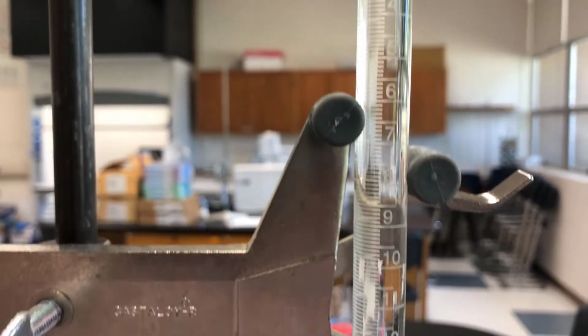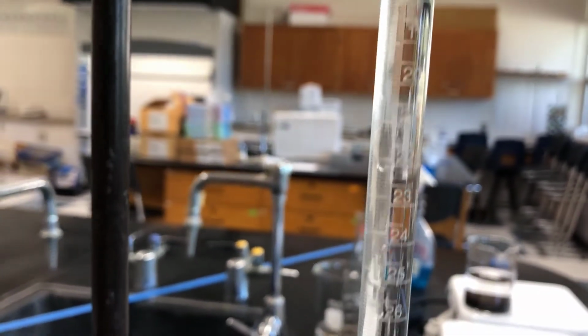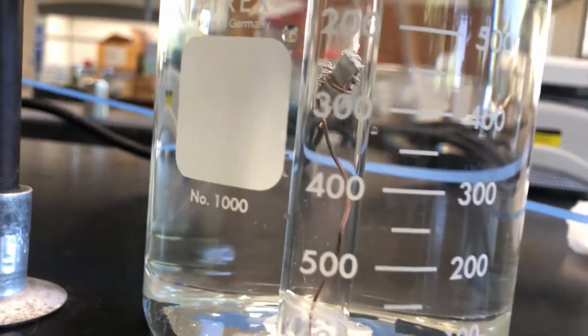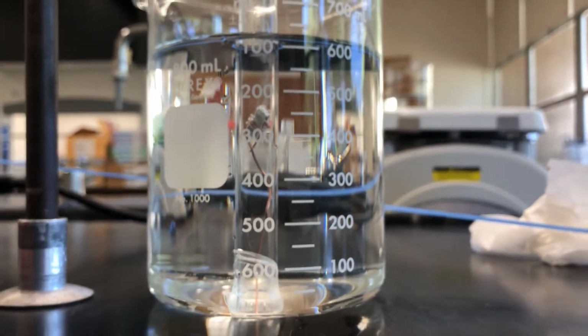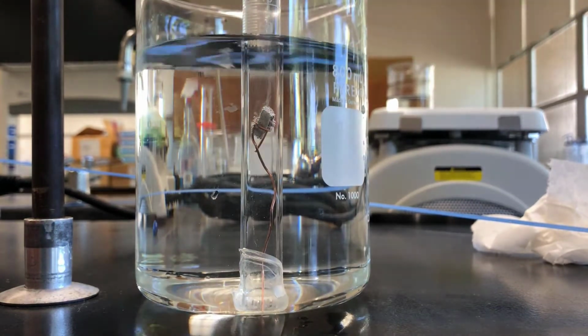All right, the hydrochloric acid is slowly drifting down. Now you can't see it. It has a little bit of color, but normally you don't get to see that. And now you can see there's bubbles coming up, right? That's because the hydrochloric acid has made its way down to the magnesium. Let me get a clear spot. Here we go. Just like that.